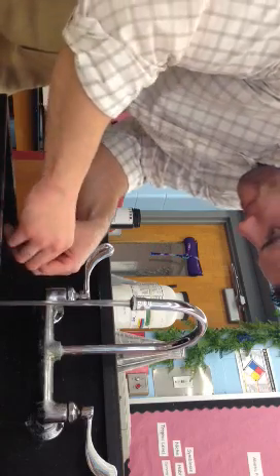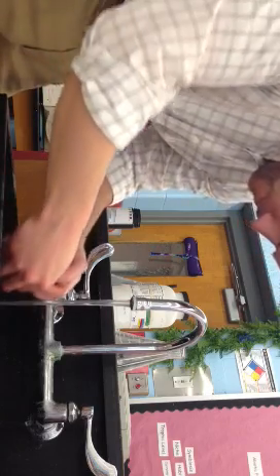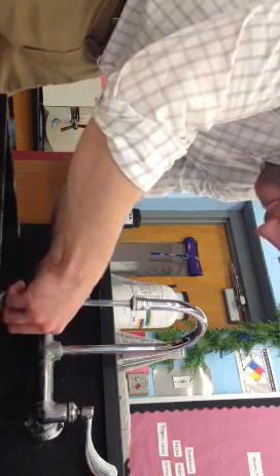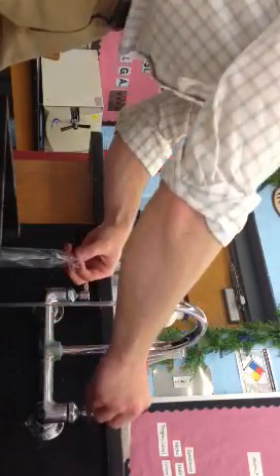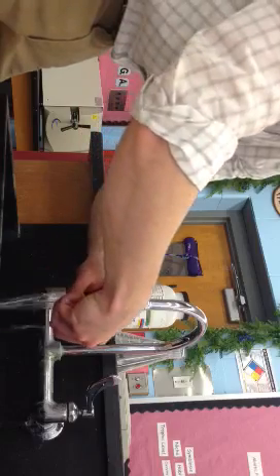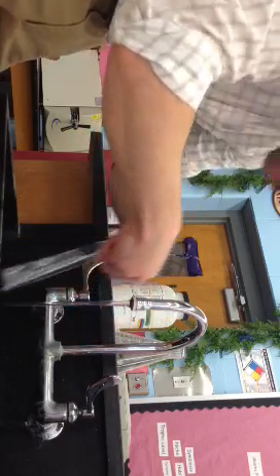And then you can get the water flowing through it, all the way through it. Now you can see that it is a tube.